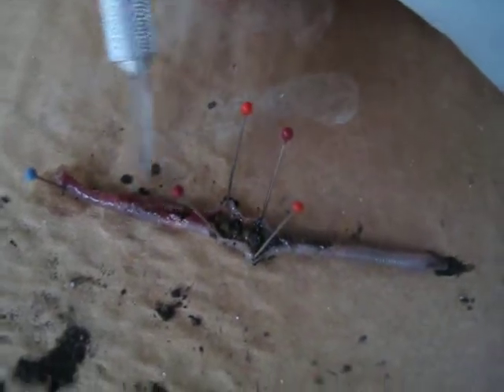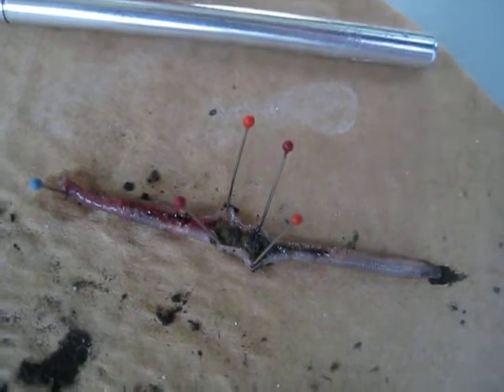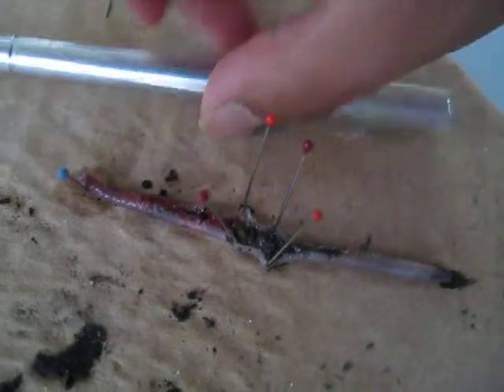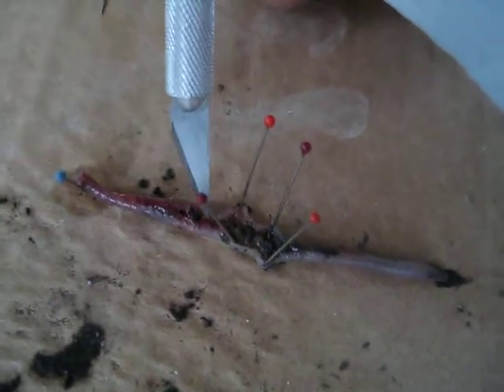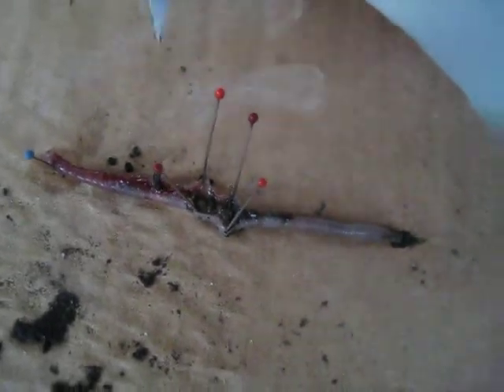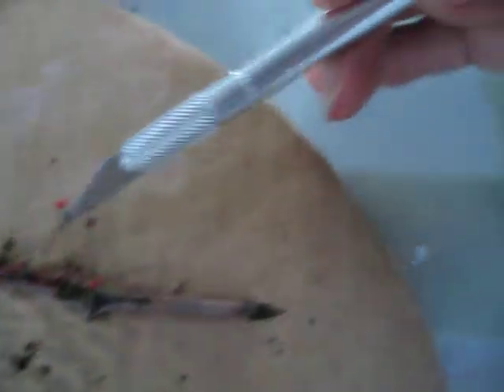This is hard. Should we open that even though it's bleeding now? Yeah, sure. Oh, I think I... Ew. This part's not open. Ew. It smells like rubbing alcohol. At least it doesn't smell like... Ew! What is that?